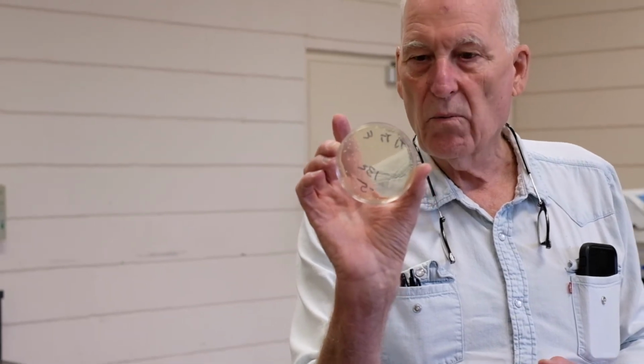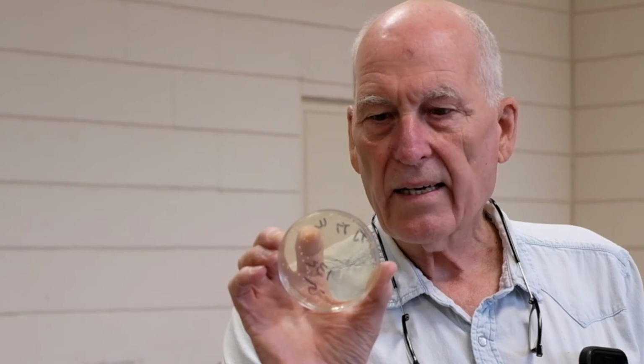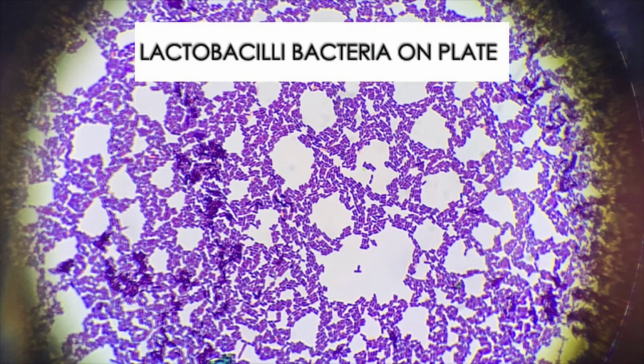And the other thing I want to point out, I'm stumbling around here, is that if you look, and I think you can see it on this camera, the type of colony looks like the same species. So it looks like 100% of whatever that is. We're going to take that, gram stain it, try to figure out, name it, so we can know what has succeeded the Leuconostoc in that fermentation. So that's kind of how we're going to do it.